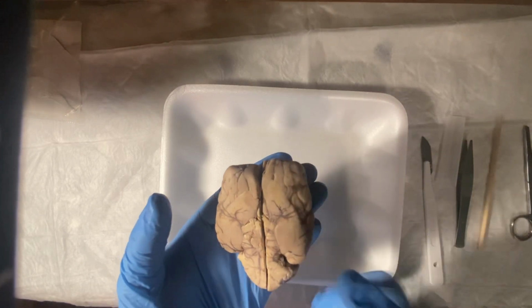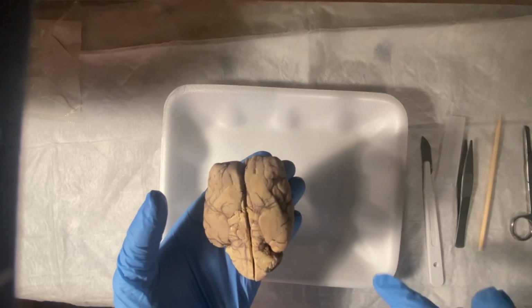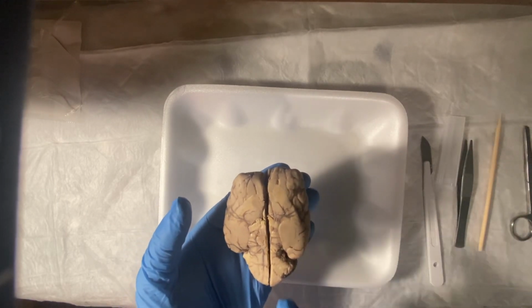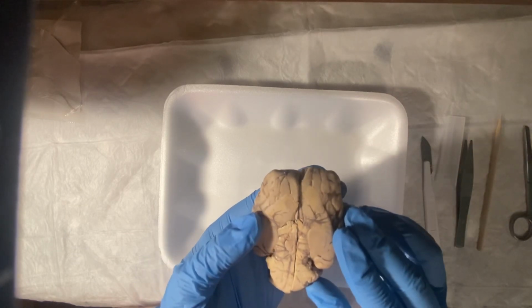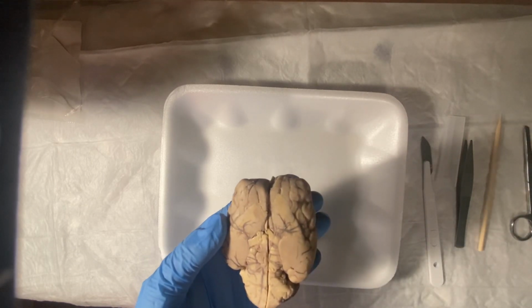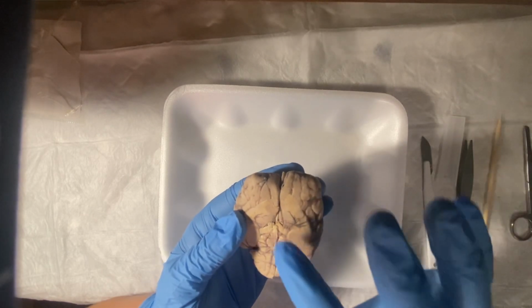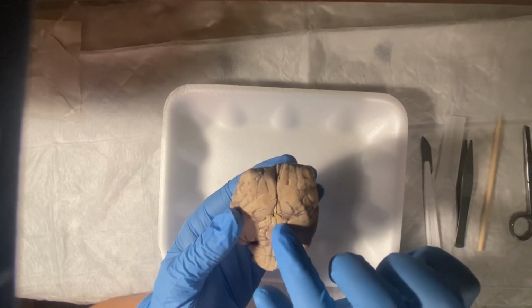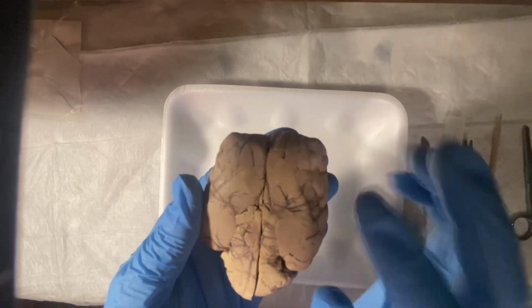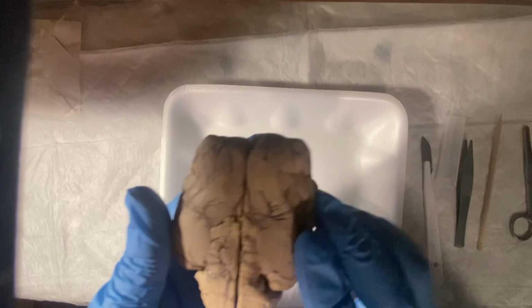And so if we see optic nerve number 2, cranial nerve number 2, I'm sorry, that's the optic nerve. And it's around the optic chiasm, which is the cross-body where it crosses. So around here, so the optic nerves are these two little, I guess they're just right there.